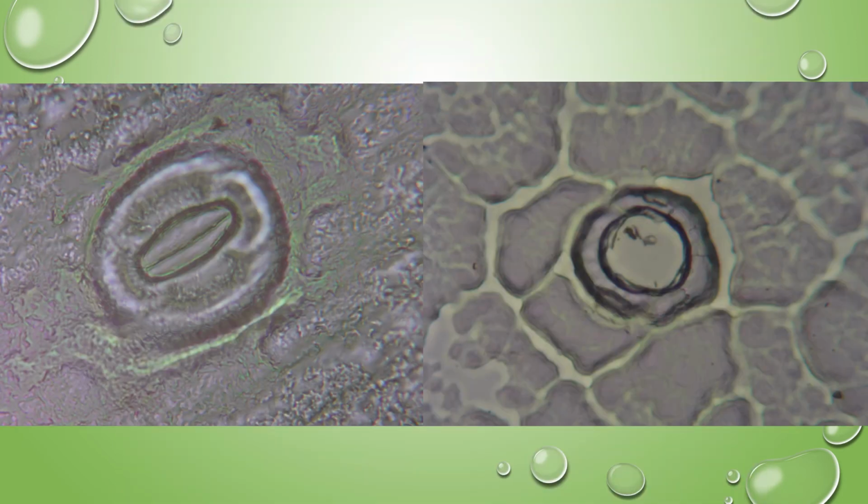Okay, so once you have got your slide and you've worked with your microscope, you're going to recognize it's going to take some patience. Getting something into focus, gross focus, fine-tune focus, and working with that diaphragm to allow light in and out. But ultimately, you're going to want to get some up-close pictures of stomata.